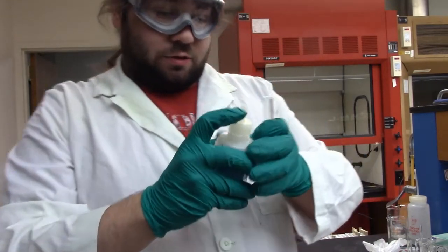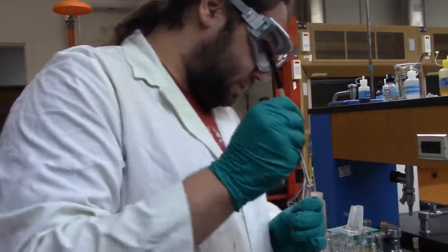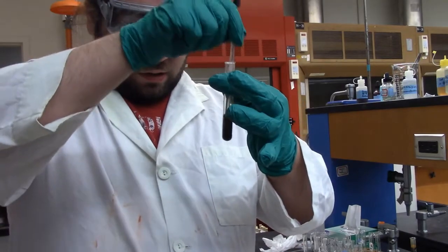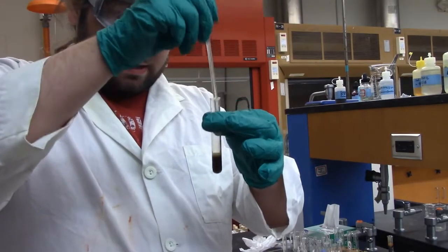A couple extra drops due to the fact that it's not fresh, because this stuff decomposes quickly, so you've got to be careful if you don't make it up right away. Mix thoroughly. And yeah, we're smoking and doing a little fizzing, so it's doing its job. And then we're going to heat it, and I'll do some science behind the scenes, and we'll come back for the chromium test.